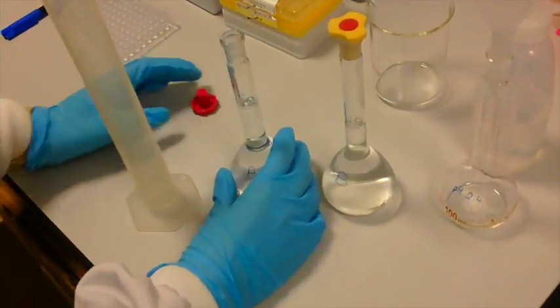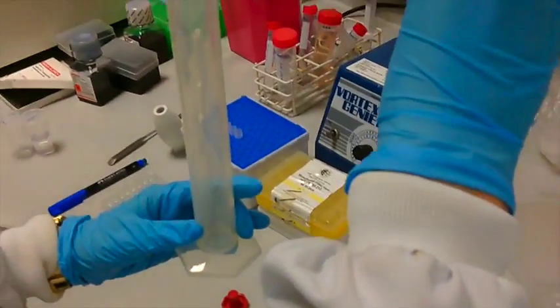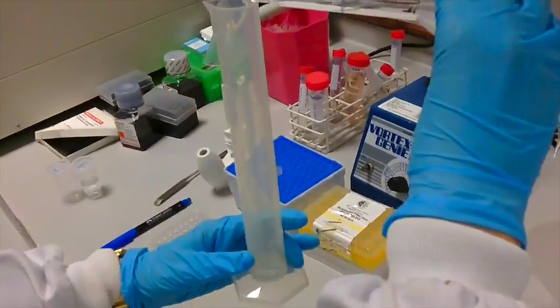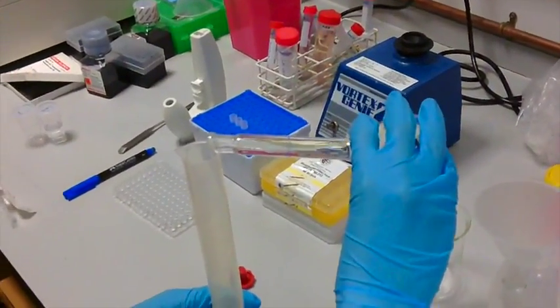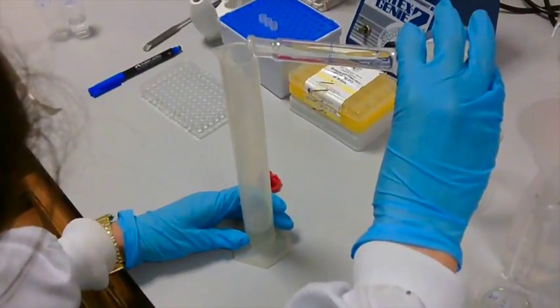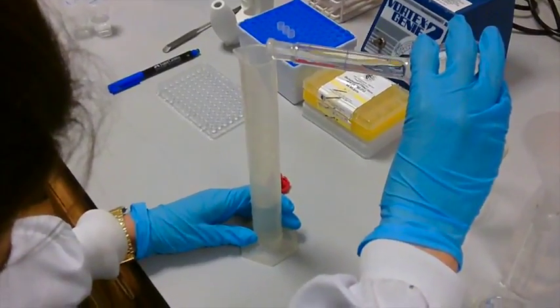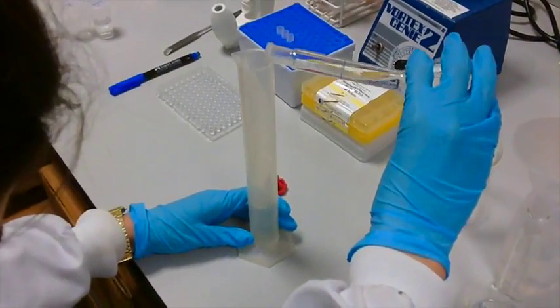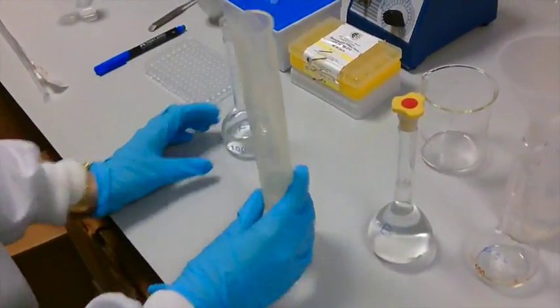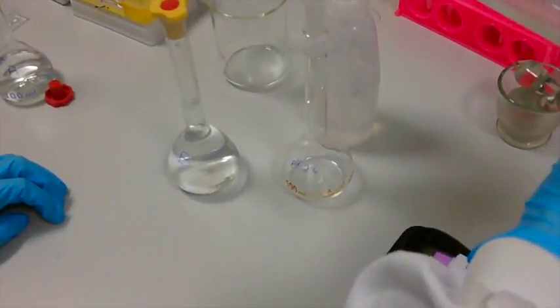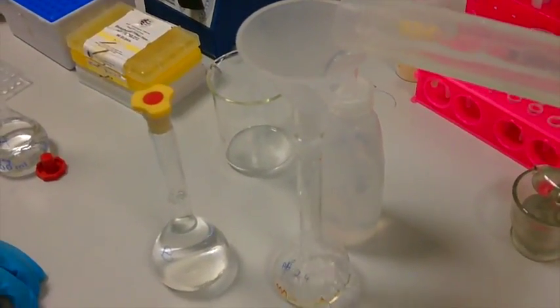The 34.6 mils of the disodium citrate buffer is poured into a graduated cylinder. This is then added to a volumetric flask that has already been labeled pH 2.4 using a funnel.